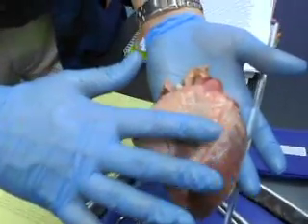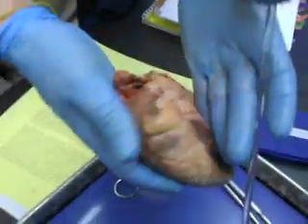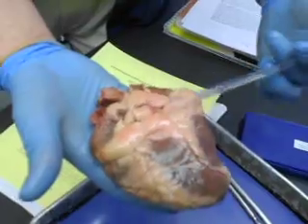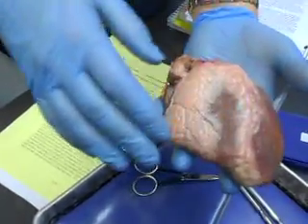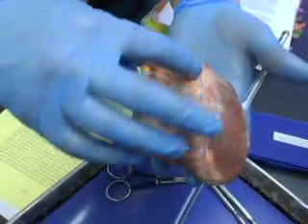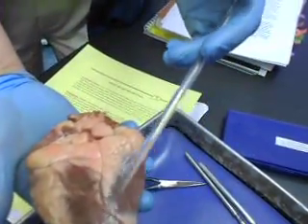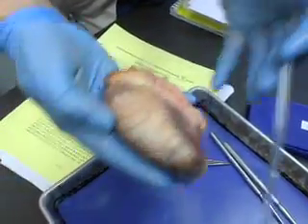This is the anterior portion of the heart, and this is the posterior aspect of the heart. This is the anterior interventricular septum, or sulcus, and this is the posterior interventricular sulcus. All this white on here is the fat.